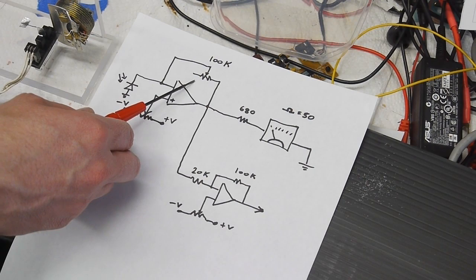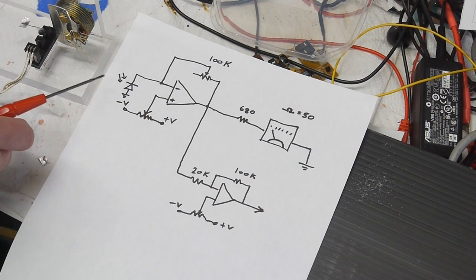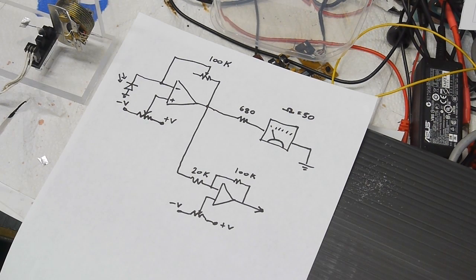This is the gain of the op-amp circuit, and it doesn't seem to have a huge effect on this thing, mainly because the photodiode turns on and off very quickly. Just the physical arrangement of this opto-isolator means that as soon as the beam break comes down, the whole circuit goes from off to on very suddenly. And that's bad because the circuit does tend to oscillate very easily. So to make this circuit at all stable, I have to tune this pot really carefully to get it into a stable area. And I tried adding filters and that sort of thing, and it really doesn't work.